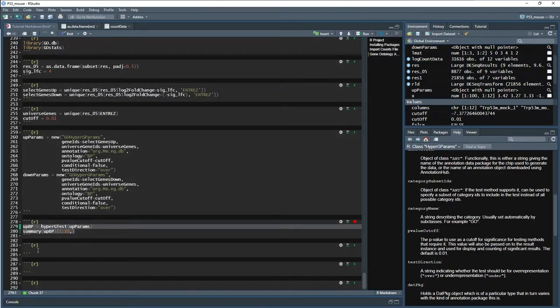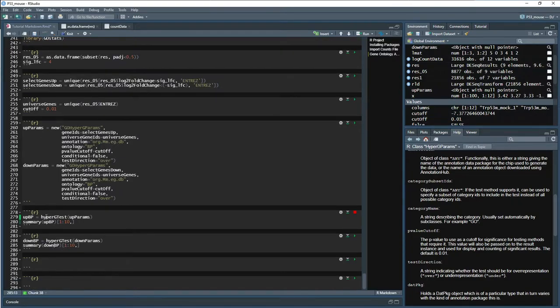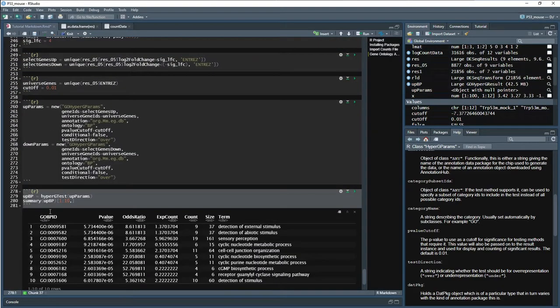copy this guy, paste it down here, and we'll just change these to down BP. And then down parameters, and it'll get tied up here because it's in the middle of something, so it won't let me run that. But since this is already going, let's go ahead and just kickstart the next one. Oh, there we go.